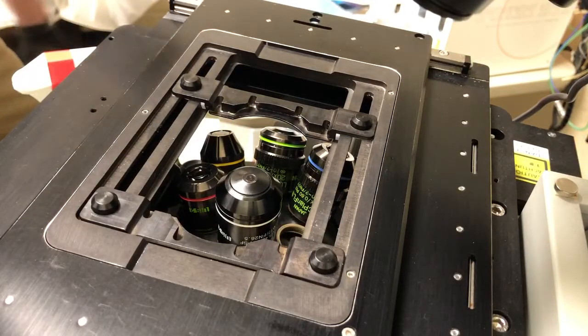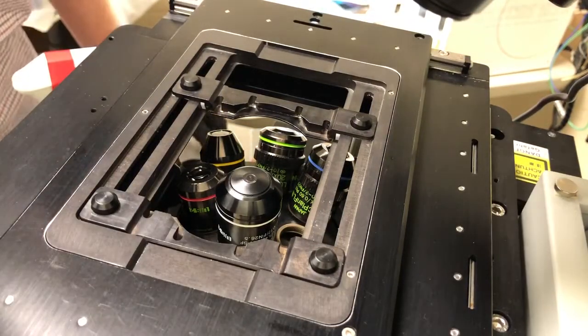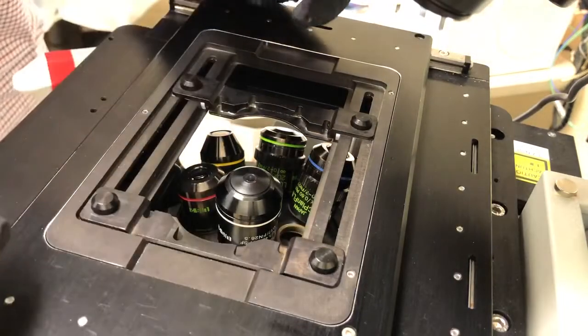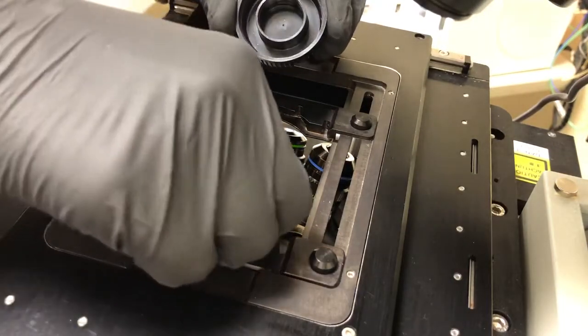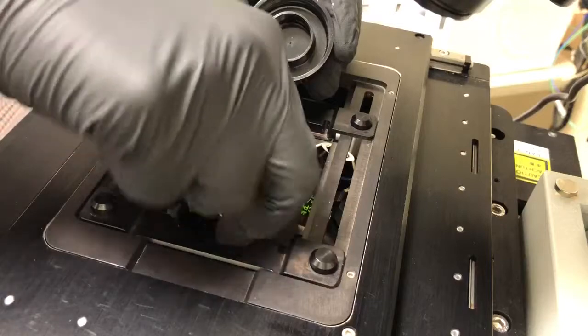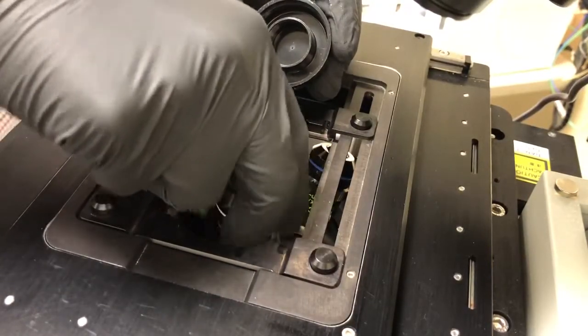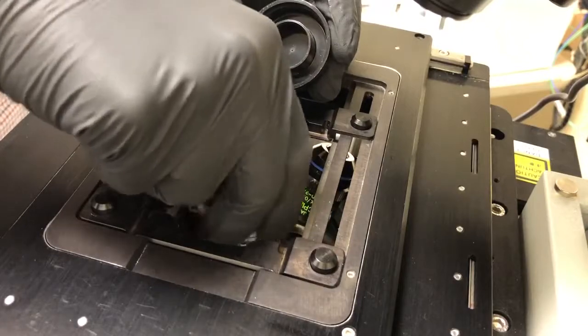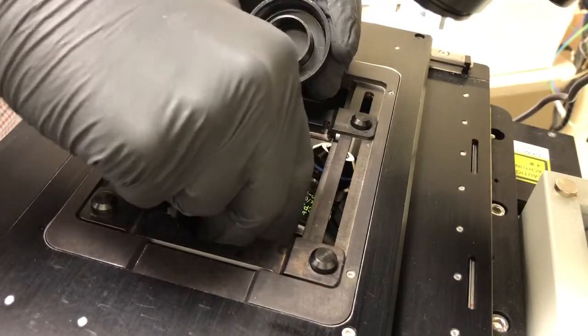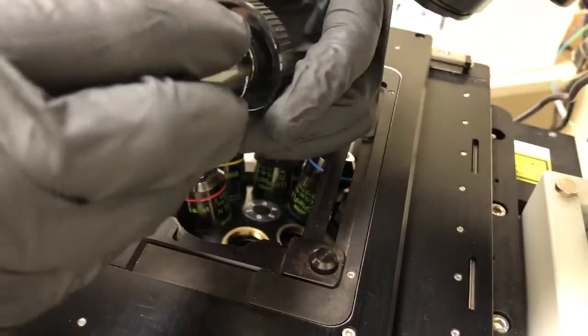The objective is nice and clean. Then I'm going to grab this base on which I'll place the objective and remove it by gently unscrewing it. Again, you want to be very careful—this is very expensive equipment. Then I'm going to screw it here.